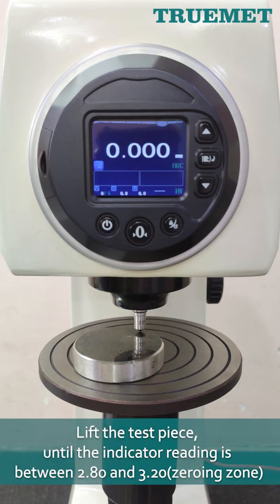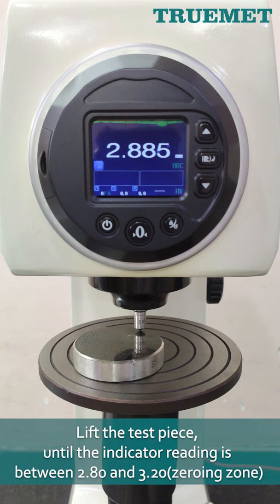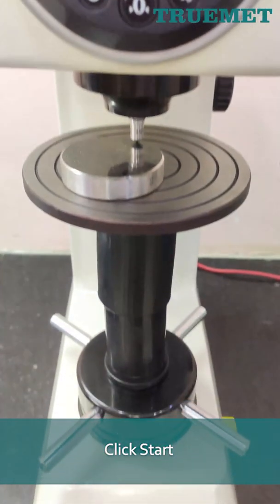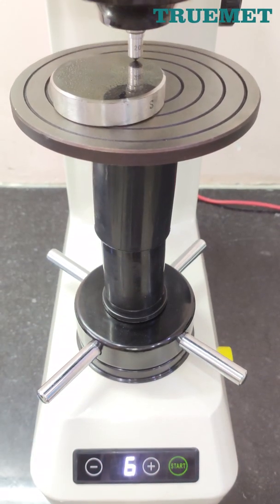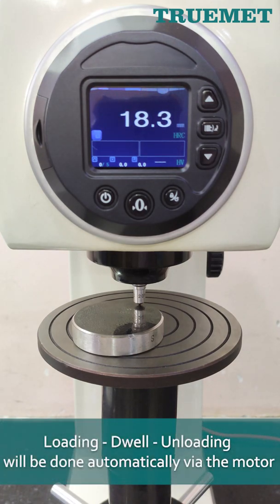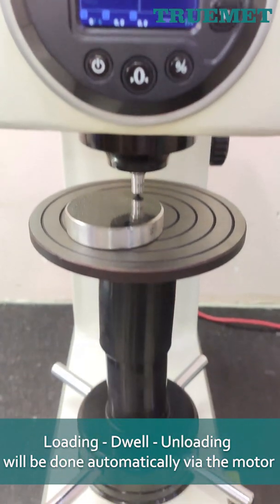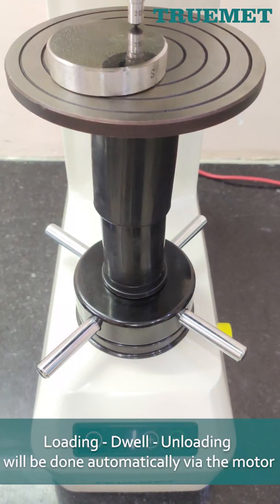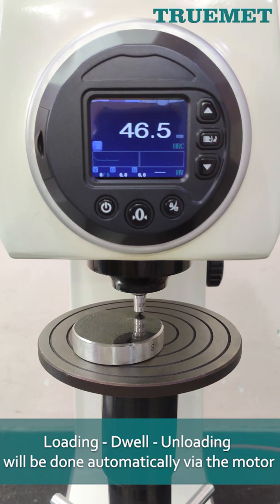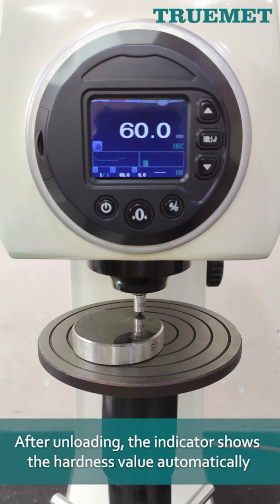Lift the test piece until the indicator reading is between 2.80 and 3.20 — the zeroing zone. Click Start. Loading, dwell, and unloading will be done automatically via the motor. After unloading, the indicator shows the hardness value automatically.